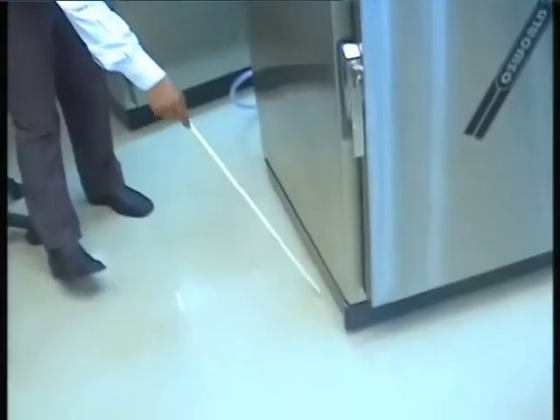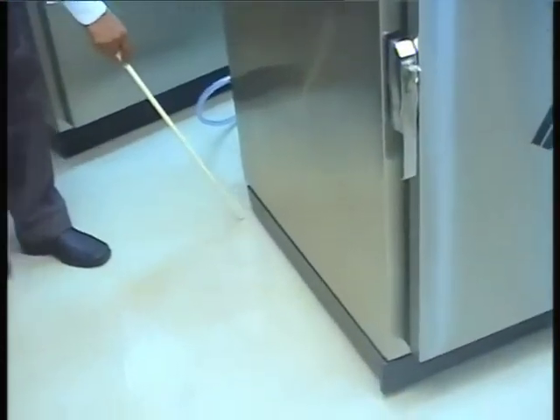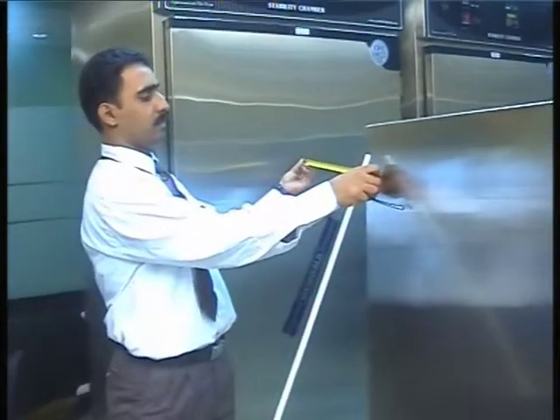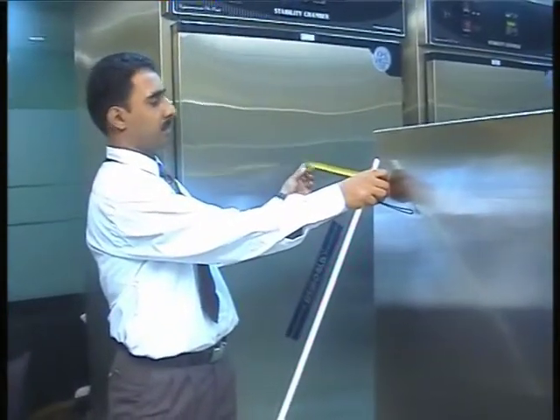Firstly, place the equipment at a designated location on a leveled floor. Maintain a 15 inch gap between the back panel of the equipment and the room wall.